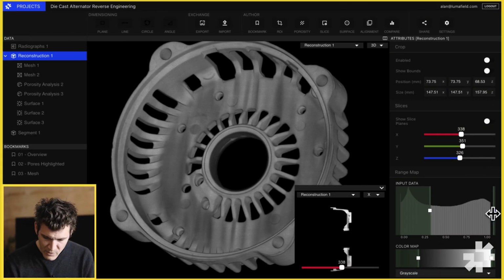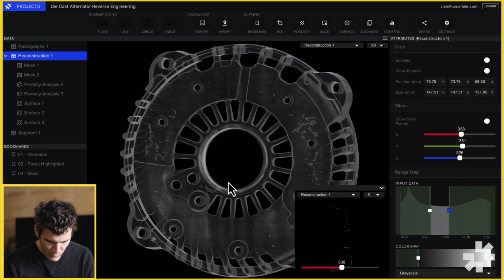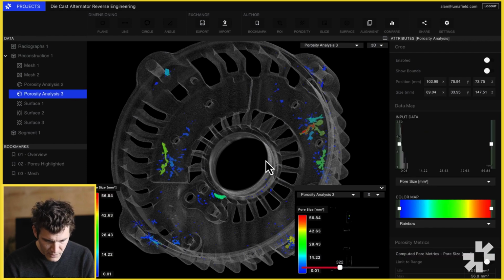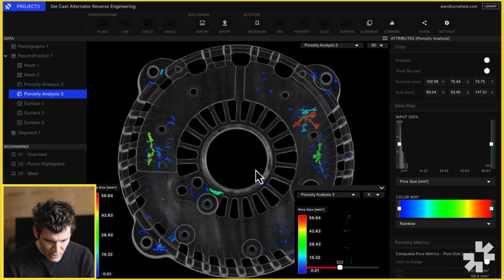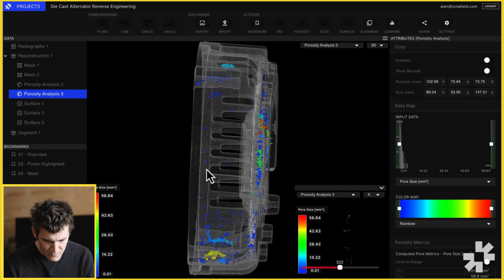By dragging the range mapper handle to the left, we can eliminate the bulk material from the view, and we're just left looking at the edges of the parts. If we go back to our porosity analysis, we can now see very clearly the edges of the parts and where the pores are relative to those edges.